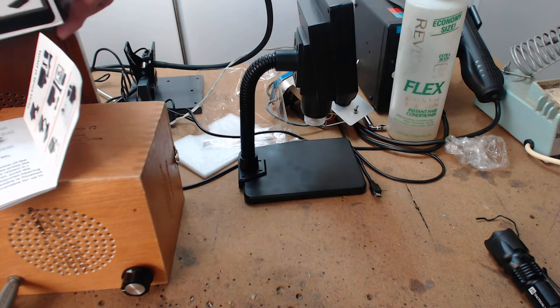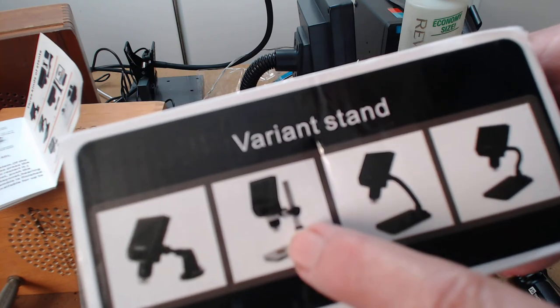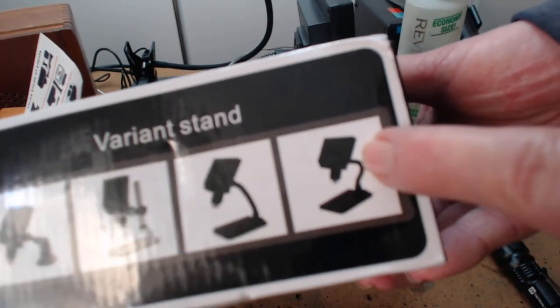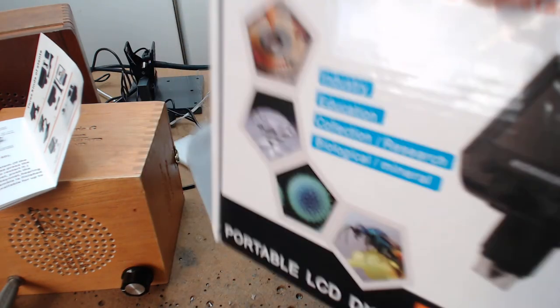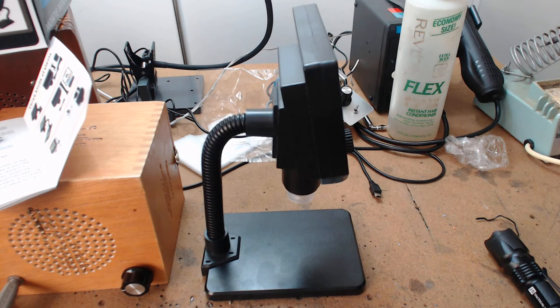Now, I paid $90. I was supposed to get this one here with the aluminum stand. What I got was something slightly worse. Now, this one here is the gooseneck. They're showing you can bend an S-curve in it. And none of these are, they're all aiming on an angle. So that shows you whoever drew this doesn't know that a microscope has to aim down. Well, anyway, that's the way this has gone. I paid $90 for it. This actual unit, if you get it on eBay, is $58 with shipping. $58 including shipping. I paid $90. So I'm going to give the person a bad review because they don't know what they're doing. China doesn't know what they're doing. eBay doesn't care. And that's where I'm at.